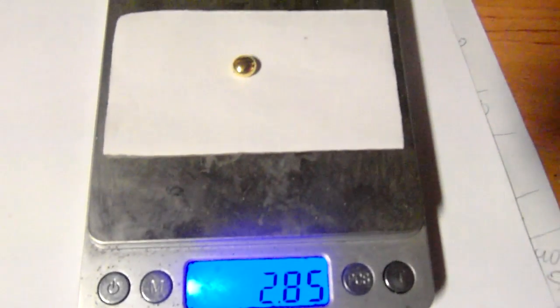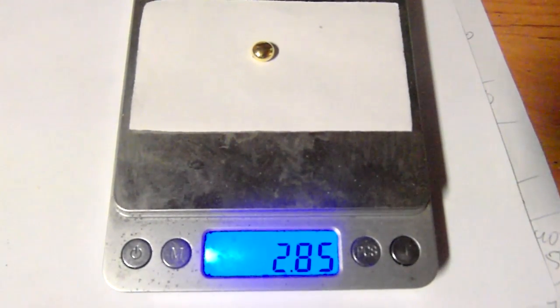And the result is a 2.85 gram pure gold button, plus the priceless knowledge.